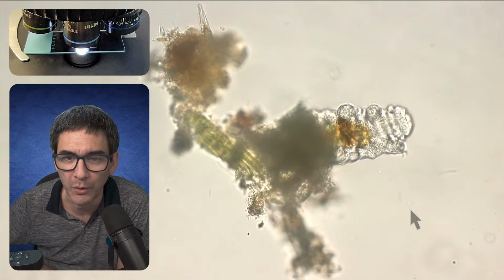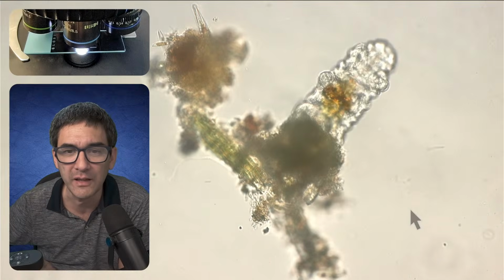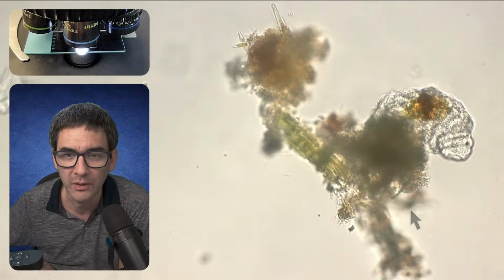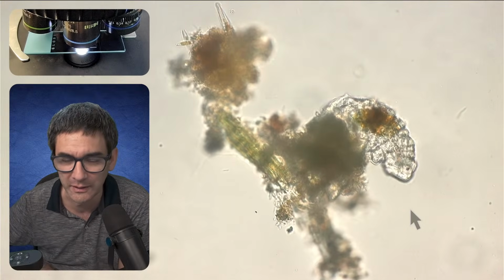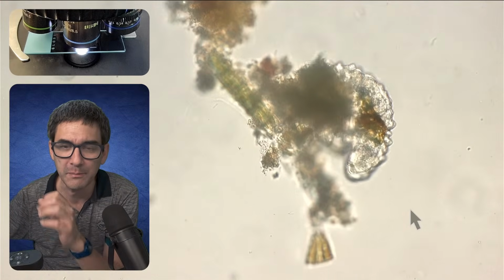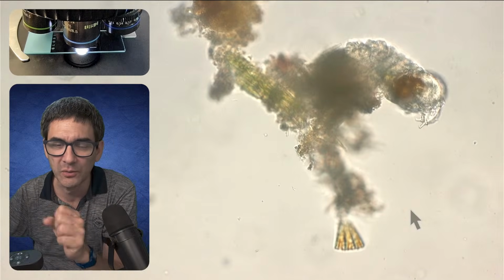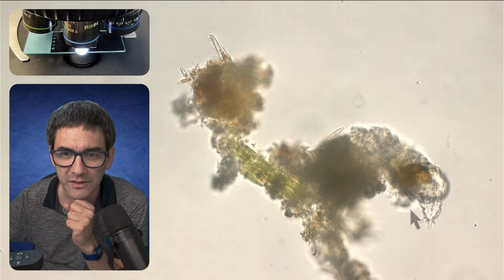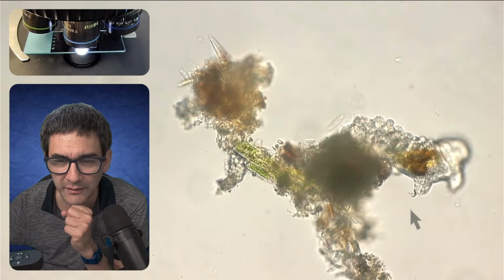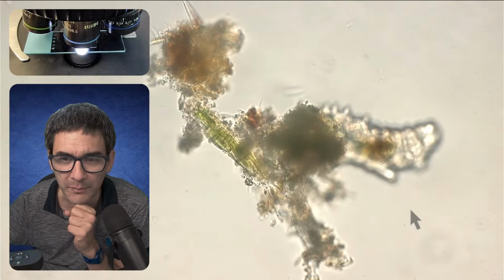It struggles to get off the moss. Strictly, I don't think that it's actually struggling to get off. They very frequently cling to the moss with their hind legs. So they actually don't want to let go. Sometimes I actually had to take a pipette again and try to separate it to completely isolate it. And as soon as it finds something to cling to again, it will attach itself to that. So I would probably say it's not struggling to get off. It doesn't want to get off. I think maybe it's looking for something else to hold on to.